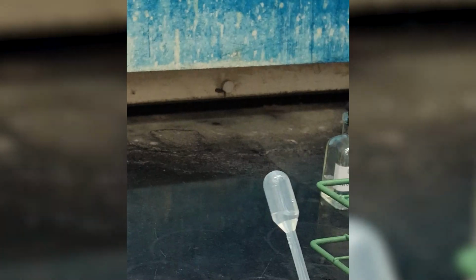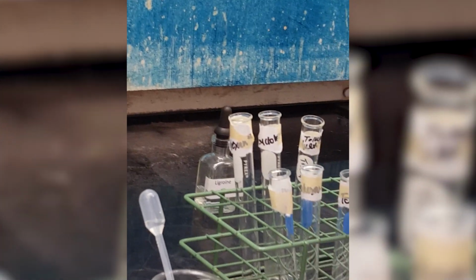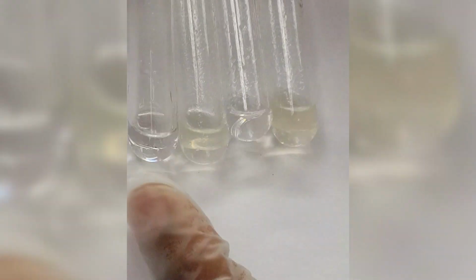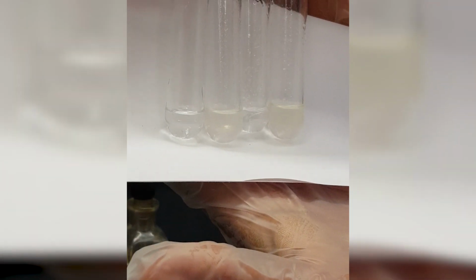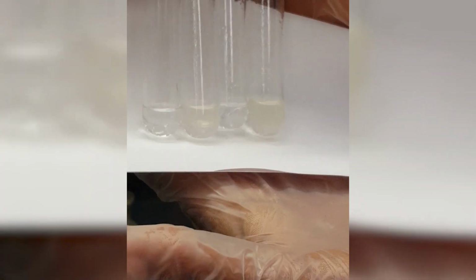So now, if I place all 4 together for water, just to help us come up with the identification of our unknown. So these are our 3 known samples: hexane, cyclohexane, toluene. And lastly, our unknown in water. This should help you come up with the identification of the unknown. You want to identify the unknown by name. You also want to identify the unknown by whether it's a saturated or unsaturated hydrocarbon.